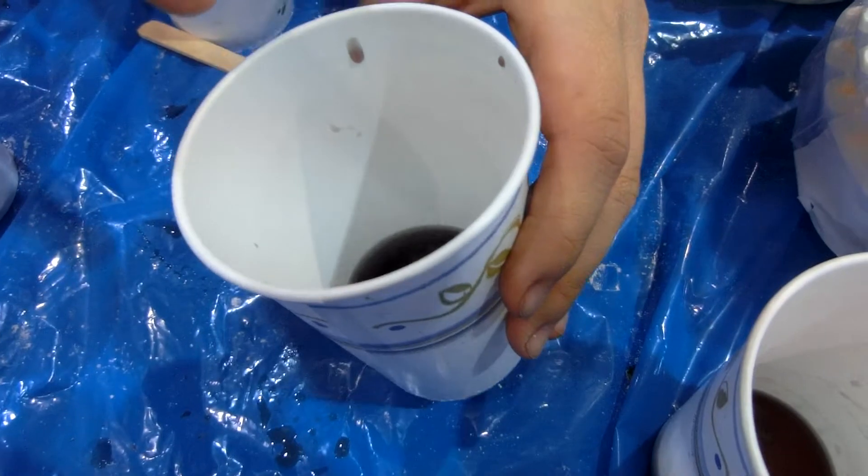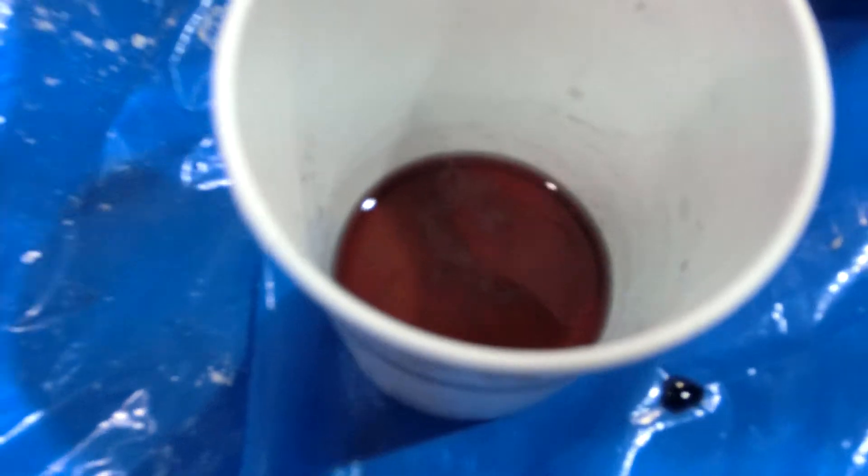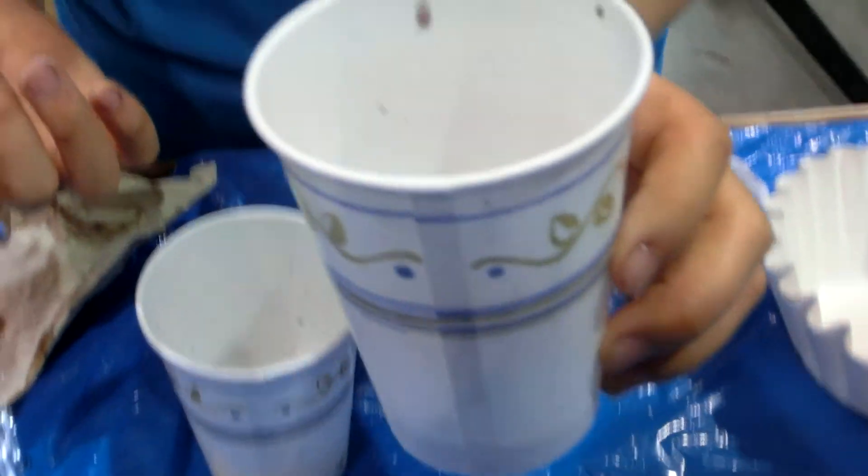It might be all floating up on the bottom there. See that white stuff? That might be strawberry DNA too. So there you go — strawberry DNA extraction. If you want, I could give you a souvenir of strawberry DNA. But that's the general gist of things — how you get DNA from the inside to the outside.